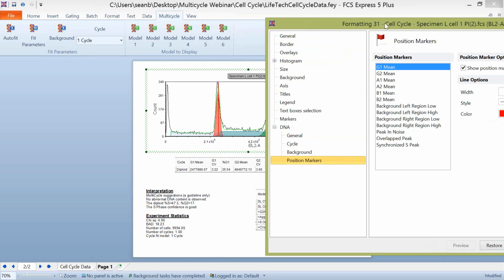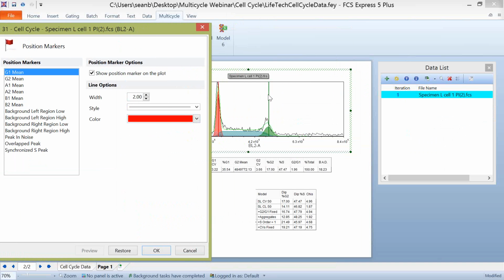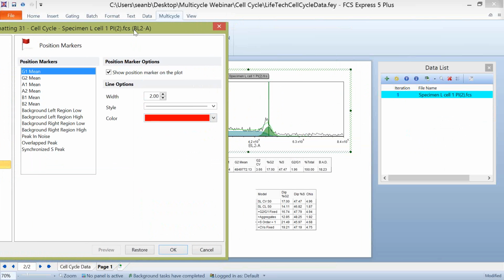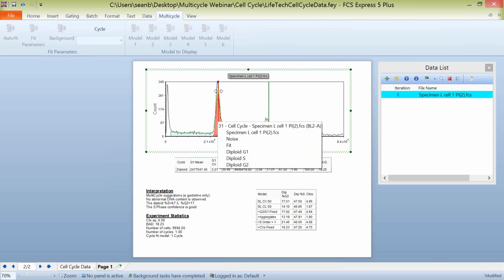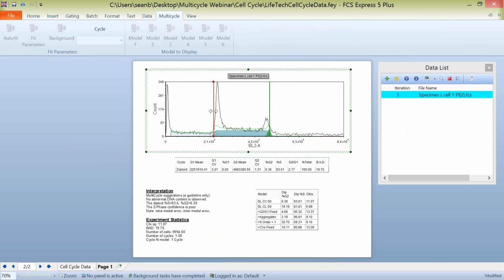But this all brings us back around to the position markers. The position markers that I've defined here on the plot for the G2 and the G1 phases, again, they're defining where the peaks for those G2 means are. And instead of actually having to go back and forth through our formatting, if you know you need to shift either your G1 or your G2 peak a little bit to reconcile where the data is on your plot to what the multi-cycle fit had been determining, these fit markers are really great because you can actually move them directly on the plot. So when we have one defined, you can see that you can actually shift that left or right, whether it be the G1 or the G2.